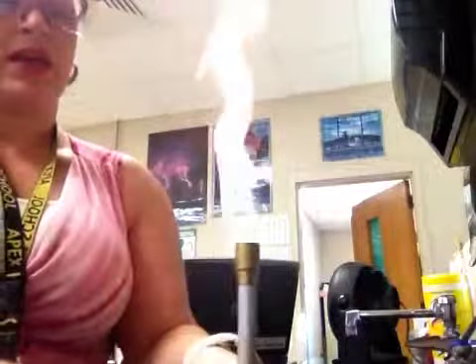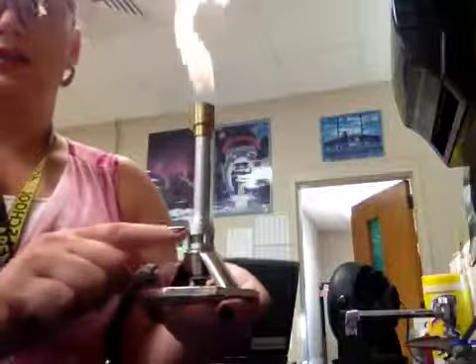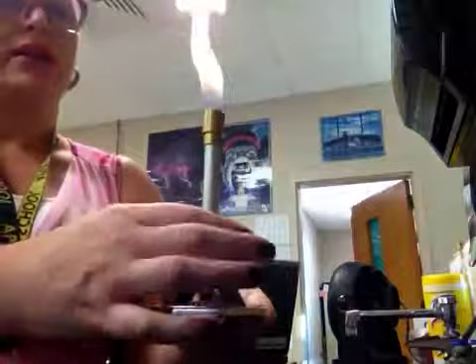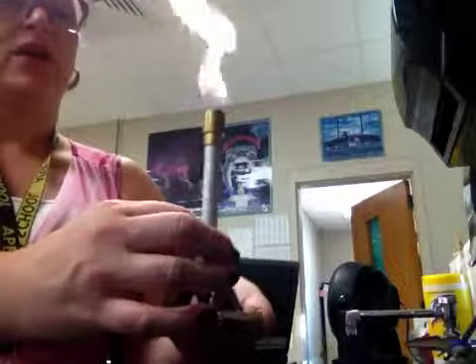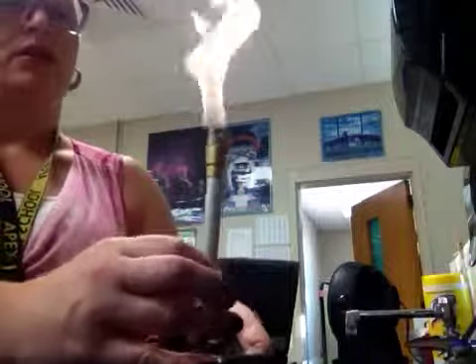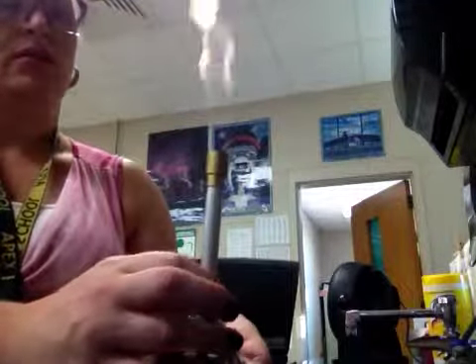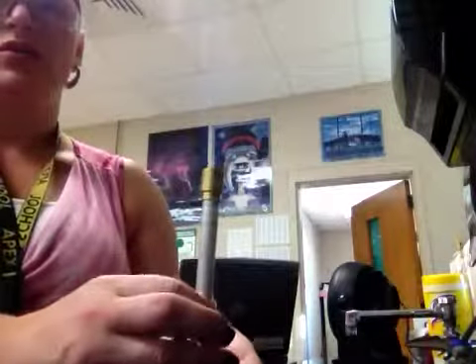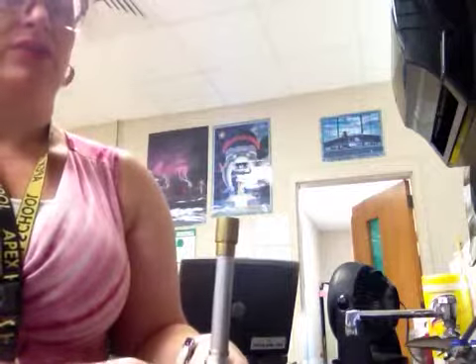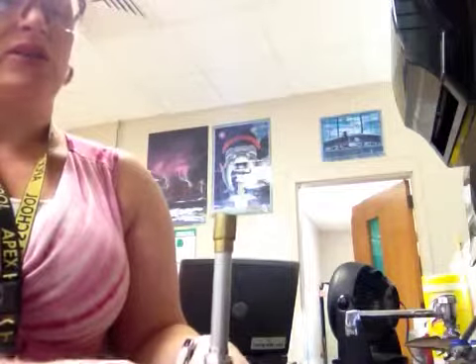I can also change the amount of air that's going into the gas — that's this thing here. It changes the air, and that's going to affect the color that I see. So if I change this, you see it turns into a nice blue flame, and that's what I want.